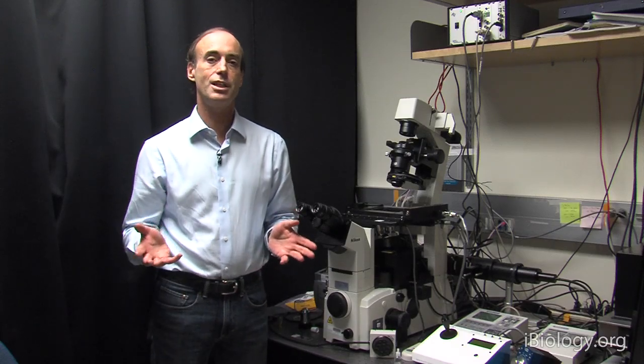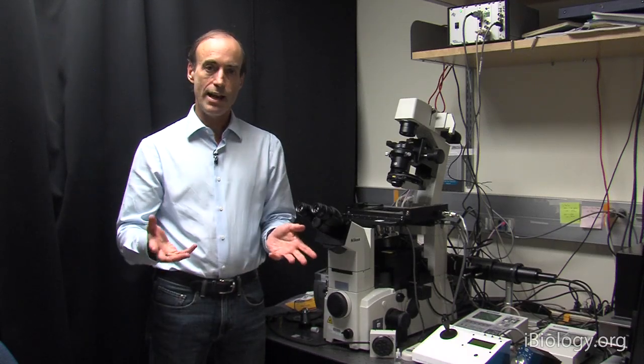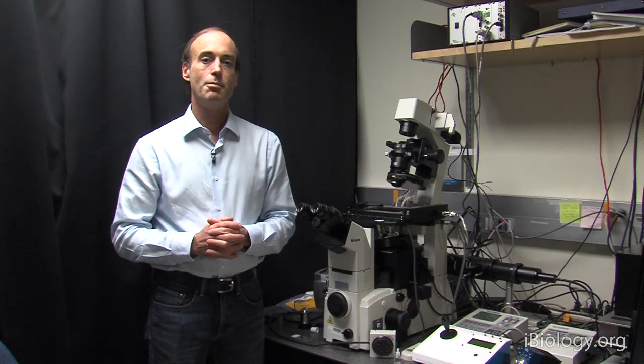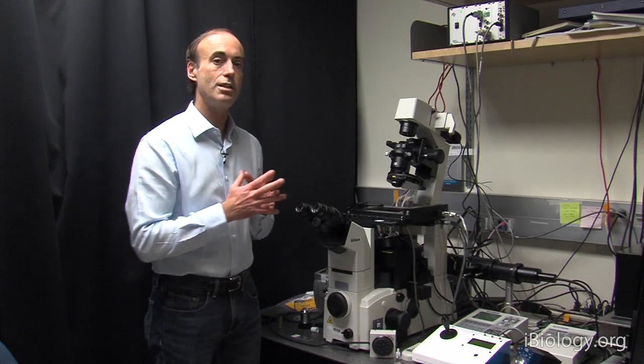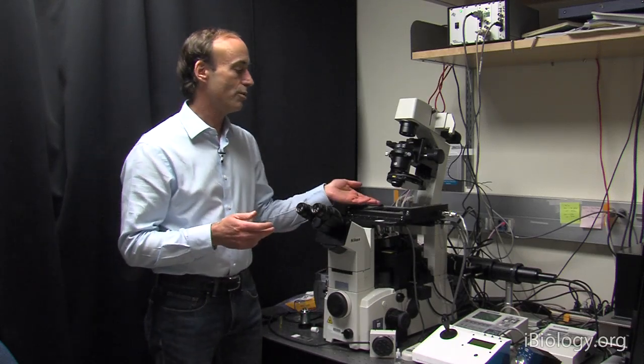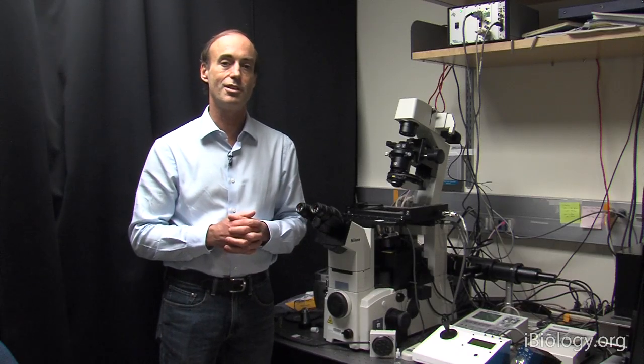We're going to go through a number of tips, but with practice, many of these steps will become second nature to you. Whenever you're focusing the microscope, it's always important to do it with a great deal of care, because you're working with an objective that can be quite expensive, often costing as much as $10,000.